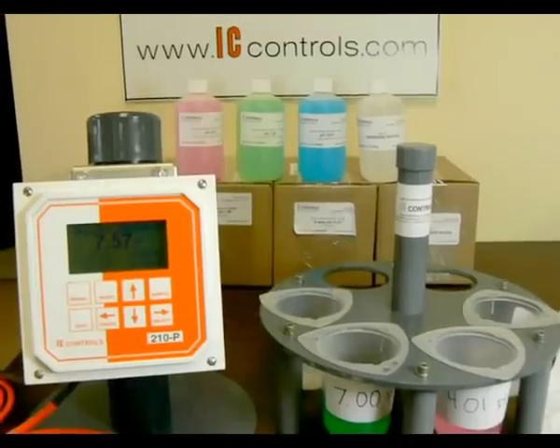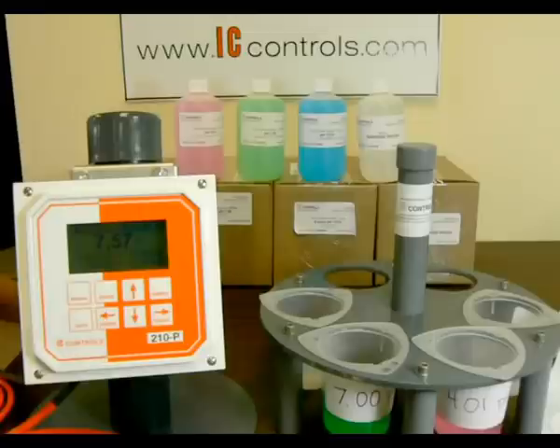Here we have the IC Controls Calibration Kit, which provides the necessary equipment and buffers to effectively and properly calibrate your IC Controls pH sensor.